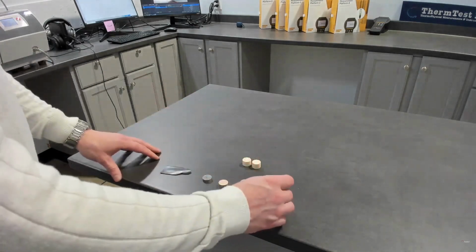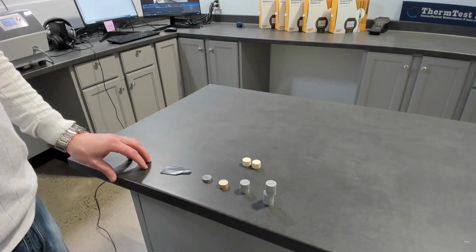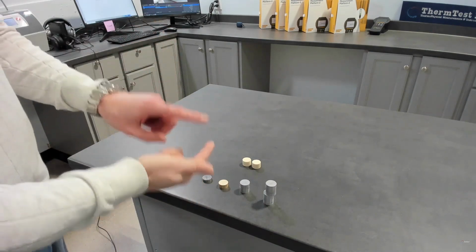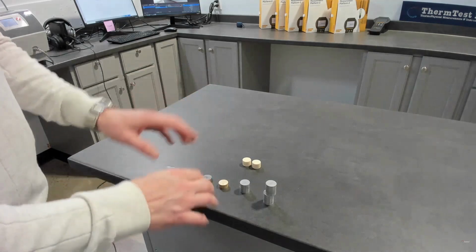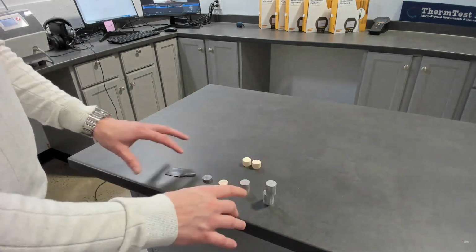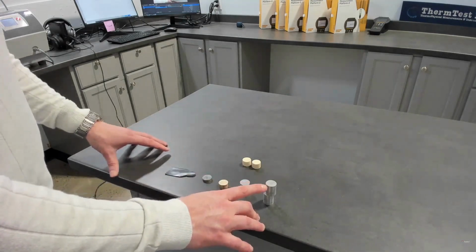Now, the one-dimensional module is described by ISO 22007-2. It's described for elongated materials, so materials that are taller than they are wide in diameter, or radially large. So we try to do our best fit to find a diameter of sensor that fits very close to the diameter of the sample.